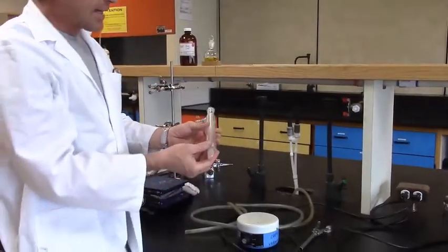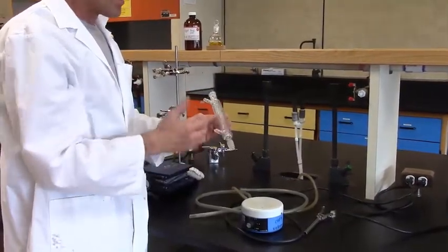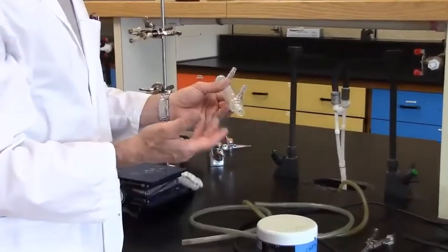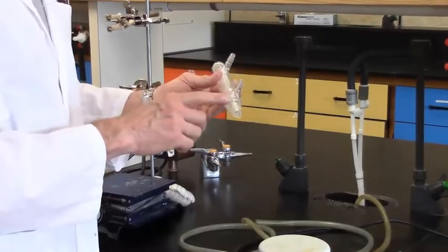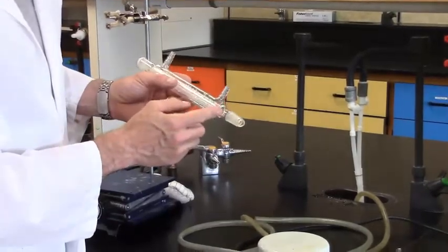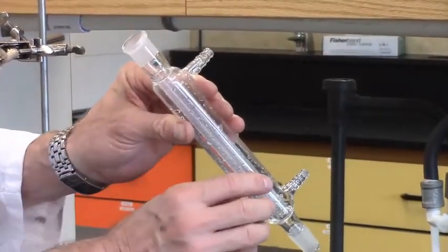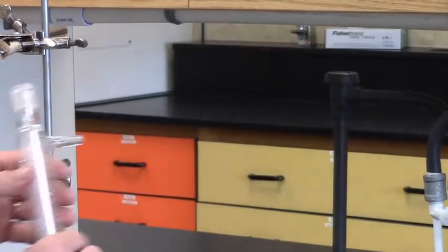The condenser itself has had water inside the column — there's not much we can do about this. We can't put condensers away dry; it's impossible to dry the column so they'll often stay wet during the entire term. On occasion you'll get organic material inside the condenser — to remove that, use hot soapy water or a bit of acetone. In most instances it will just be organic vapor residue. If there are organic solids, it will look white and chalky and will need to be cleaned. You can look down the length of the column — because the inside glass is very clean, you'll see high reflectivity, almost like a mirror. If it looks clean with no white chalky residue, it's good to go back into your container for another day.